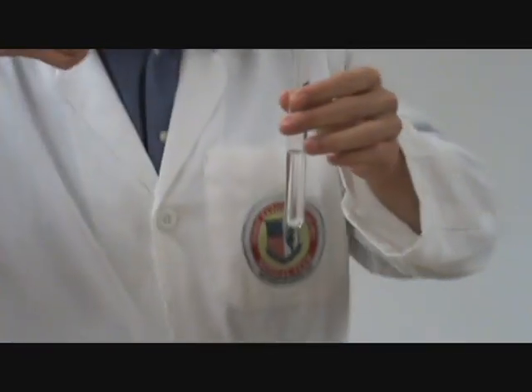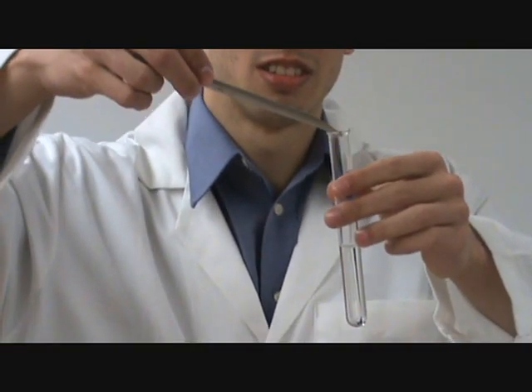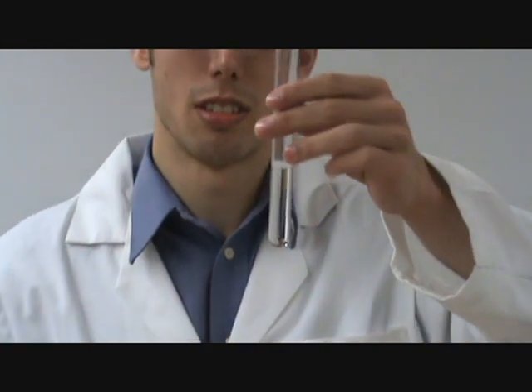Just a small amount of crystal placed into this vial is going to start a reaction, and the crystals slowly and slowly grow.